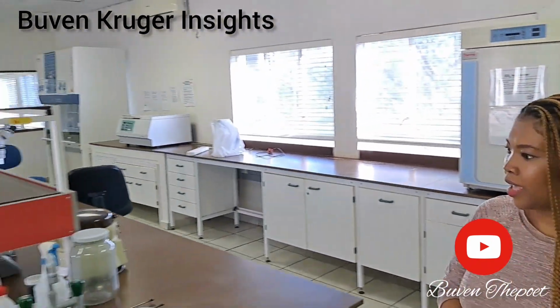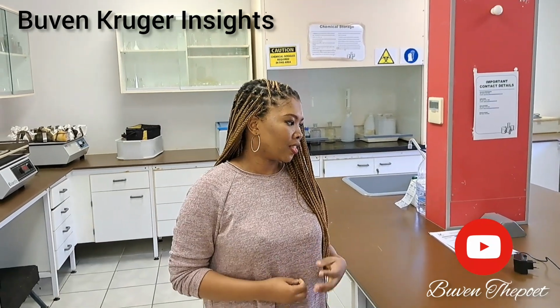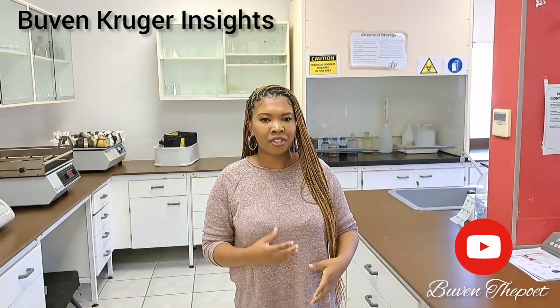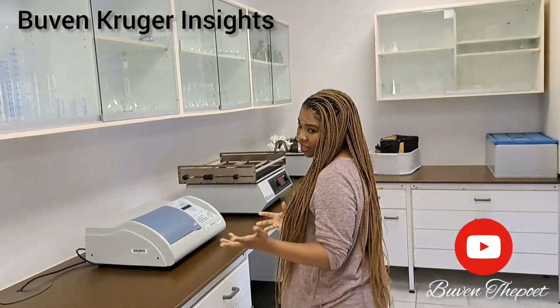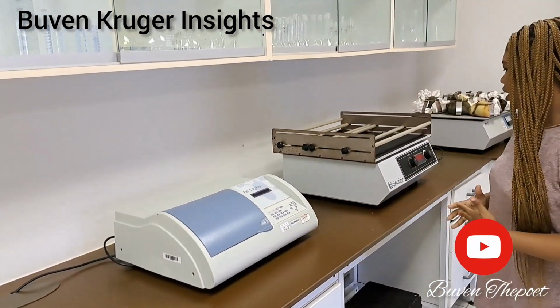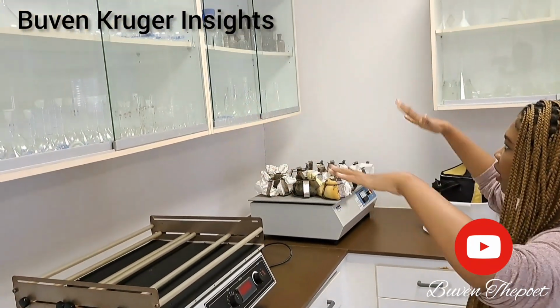So this is our analytical lab. This is where you do your chemical analysis. Over here we have your spectrometer, your pH meter. When you want to do your water analysis, if you want to monitor your physical parameters like your pH, these are all the equipment that we use. On the side we have a UV light, and then we have shakers.